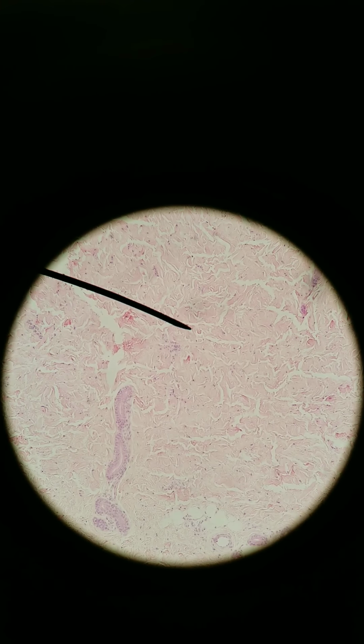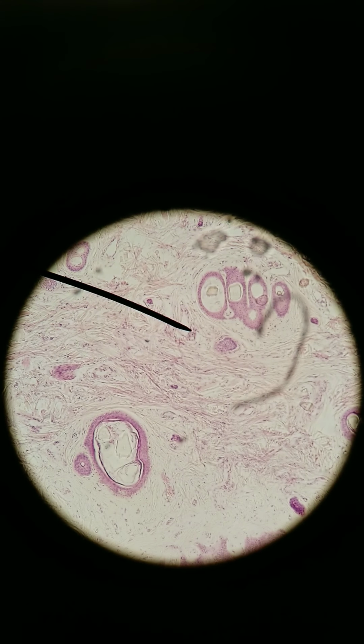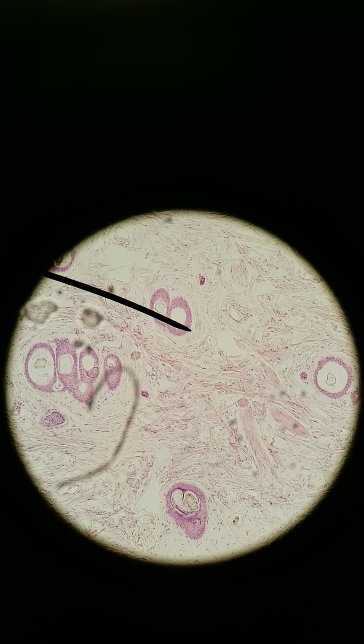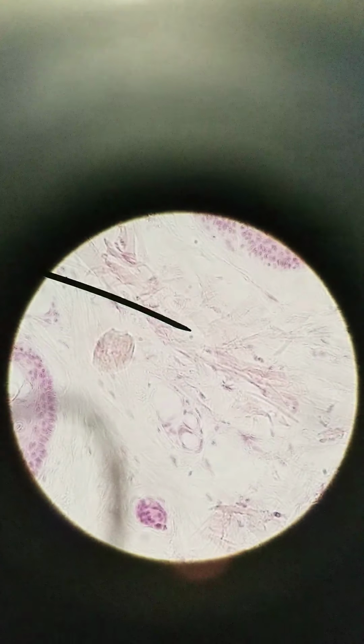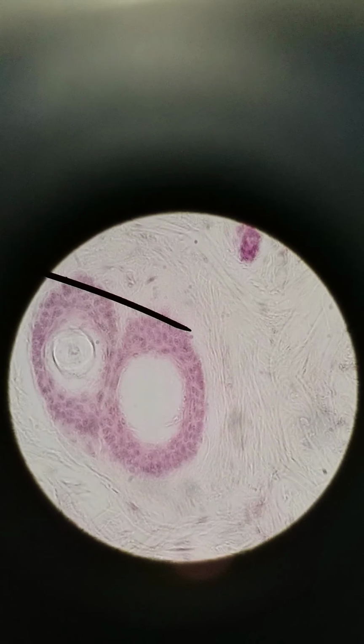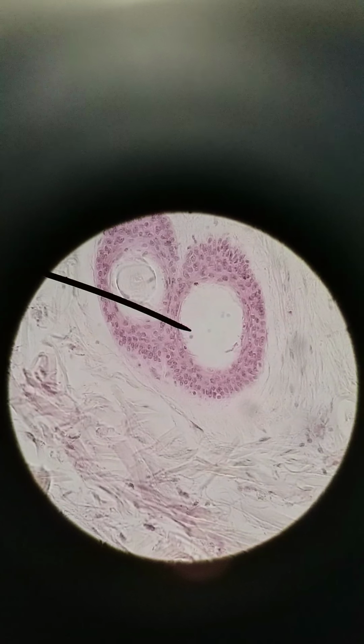This one doesn't have hair, so let me pull up one with hair. To differentiate hair follicles from glands, hair follicles always have multiple layers, more than just 2 or 3 layers. So I'm going to go a little closer. We can see 3, 4, 5 layers here of dark colored cells. It's all epidermis. It's all epithelial cells. Hair and glands are both epithelium, so they look very similar. And they both have lumens, both have cavities, but there's going to be more than 2 layers for hair follicles, only 1 or 2 layers for glands.